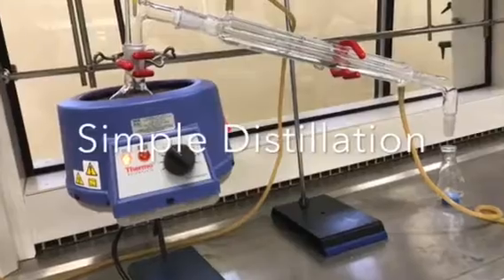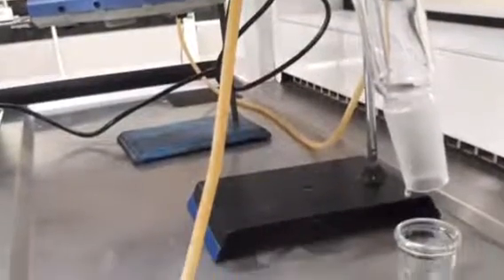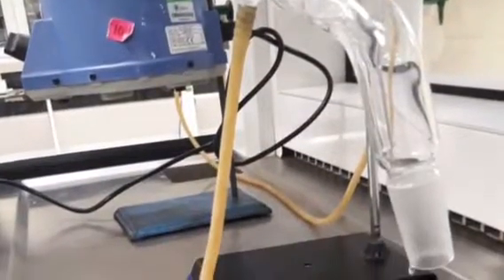Place the alcohol in the distillation flask. Verify that all the materials are properly connected, and ignite the heater. Check the temperature continuously. Don't forget that the water must flow in the refrigerant. After a while, the alcohol will be separated.